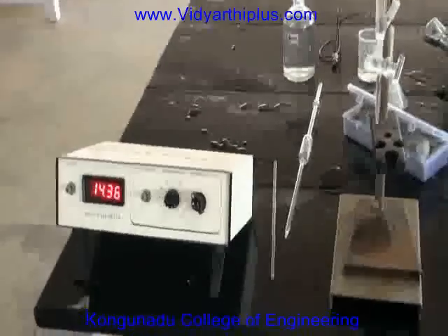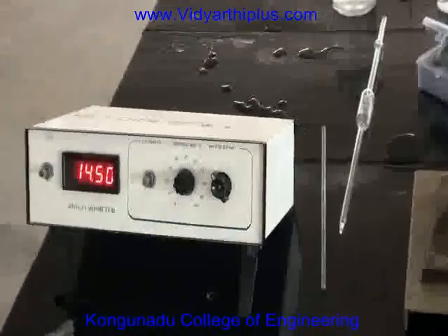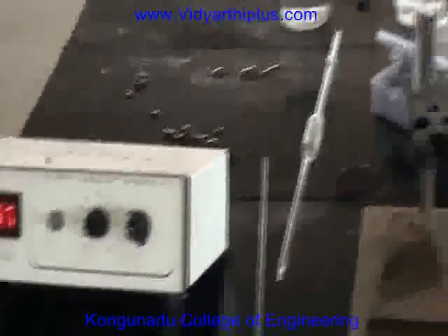The experiment is the determination of strength of HCl by pH meter.